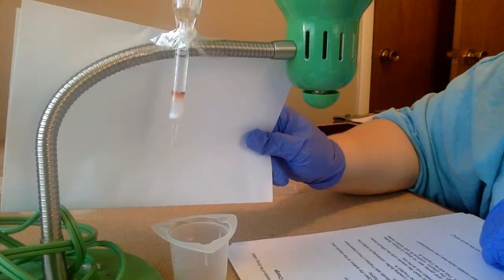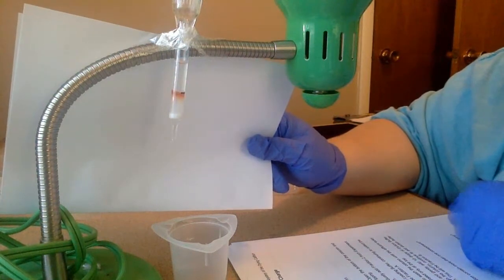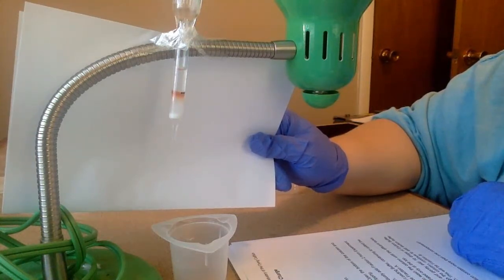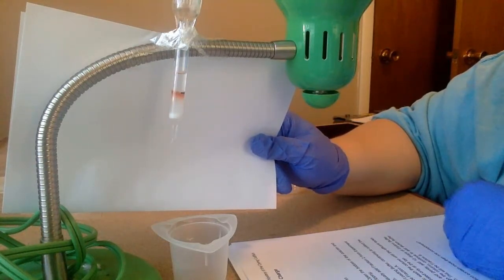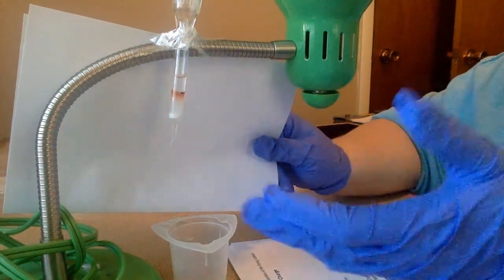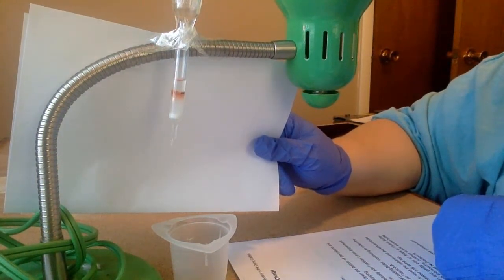So what I'm going to do in step 5, if this is our ruffinotoxin, what we know about it is it's positively charged when it's in an acidic environment. So right now it's in an acidic environment and it is charged positive. Since it's charged positive, it sticks to our negative beads, and that's why it's not coming out, because right now the substance that I'm flushing through at the top is an acid.